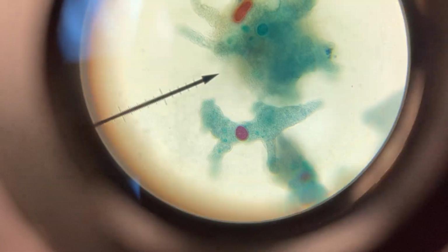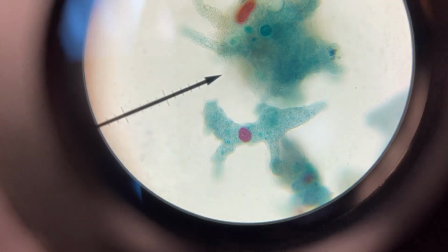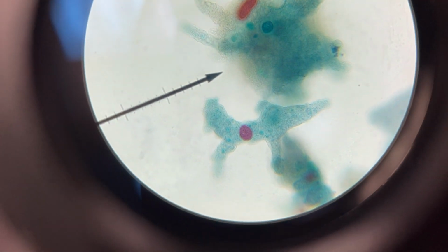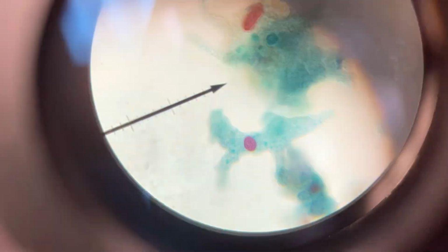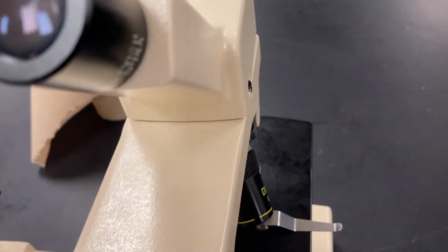And I think that's the only part you need to label. Okay. There's a nice picture of the amoeba. There's a couple in there. Okay. Next up is the Paramecium. Let's find the Paramecium. That's over here. On the Paramecium, you're going to be labeling the cilia and the oral groove.